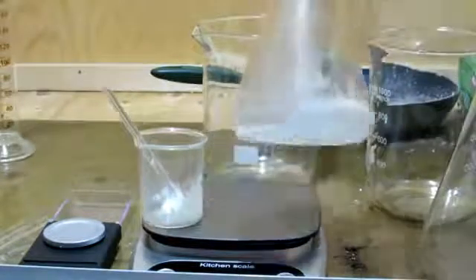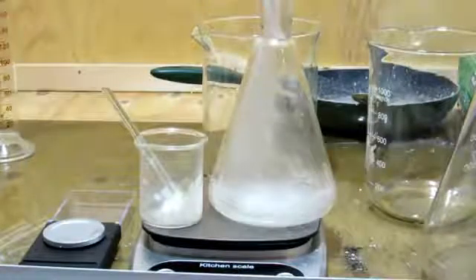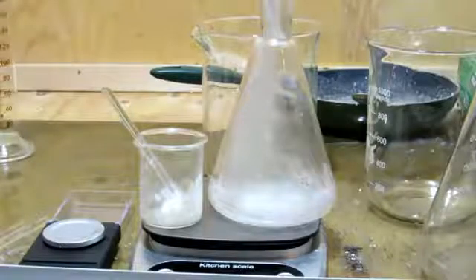And you can see in this distilling flask beside, there's lots of phosphoric acid and impurities left over, which simply didn't distill over. And this flask should be easy enough to clean, as it's all soluble in water, and water should simply rinse everything out.